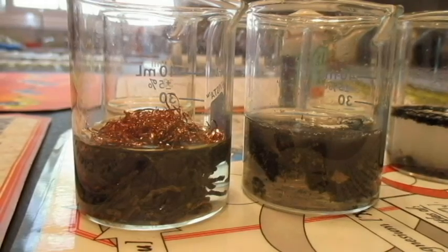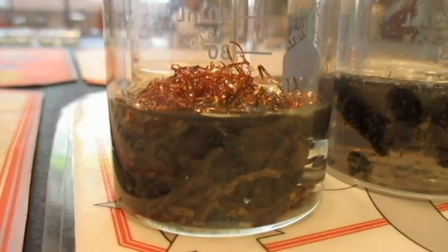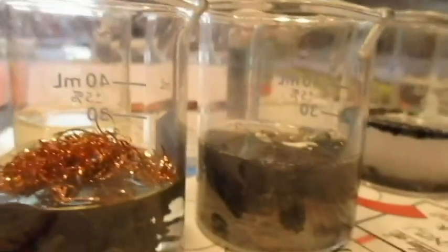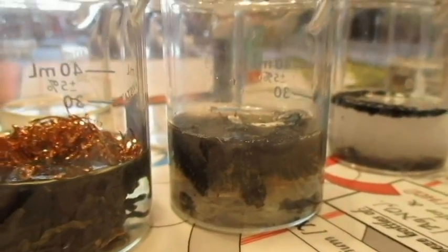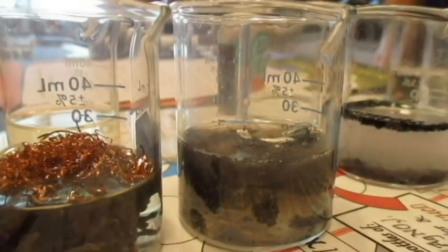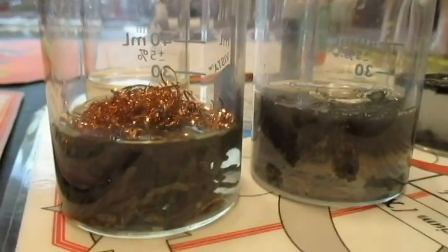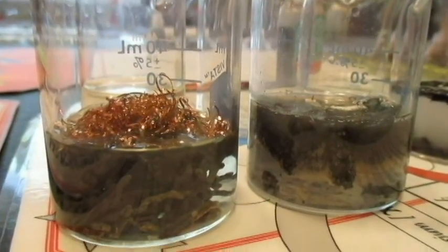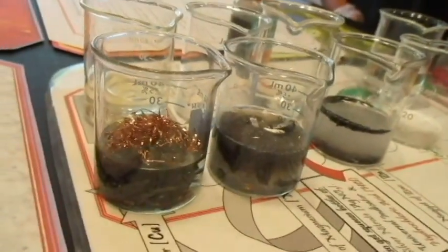Probably bubbling or changing color. Changing color. Yeah, because look at that. That doesn't look like copper anymore. Oh, it just started floating to the top. And that doesn't look like magnesium anywhere. Yeah, so that means there must be some bubbles there to lift those things up to the top. The bubbles stick to them sometimes and elevate them. So what do you think all that gray stuff could possibly be? All of that goopy, gross gray stuff. What do you think it must be? The silver nitrate.